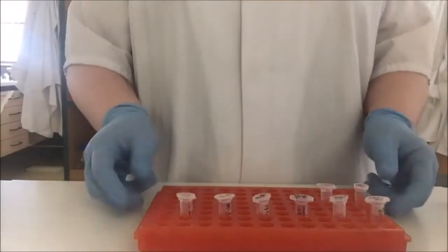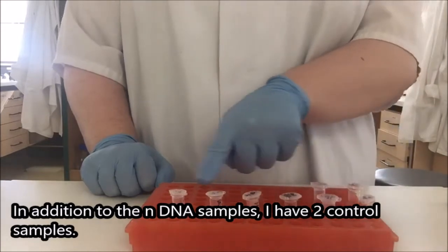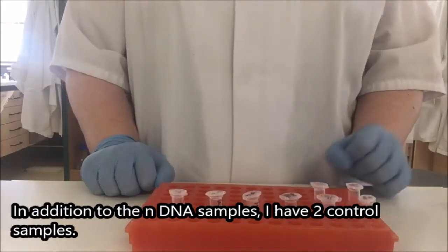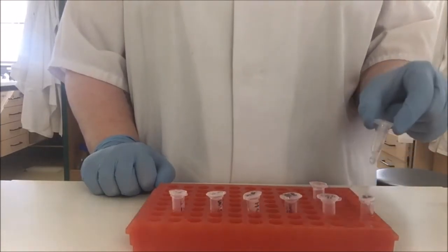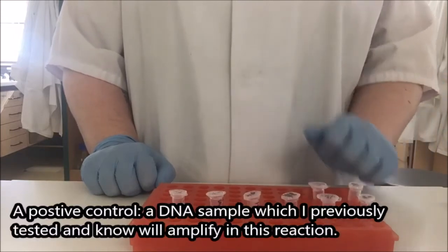In our usual work area I have my DNA samples. So I have the 6 DNA samples that we extracted as a class, plus a sample which I have previously extracted and know works, and a sample of water.